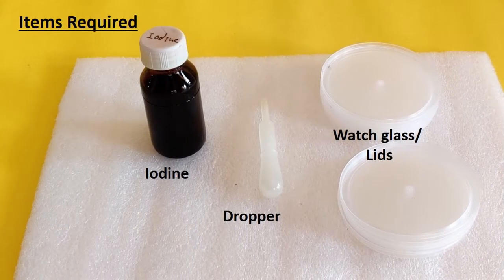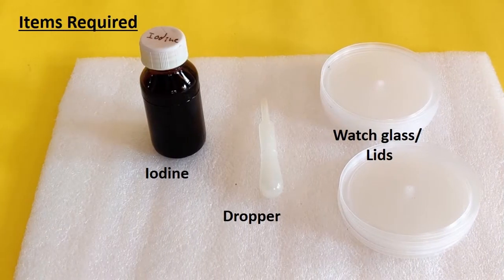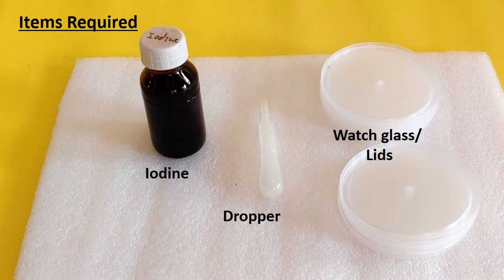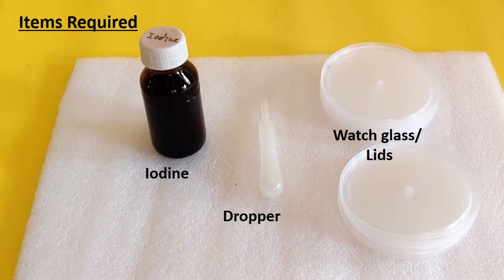For this we will need iodine, a dropper, and watch glasses or alternatively lids of some cups.